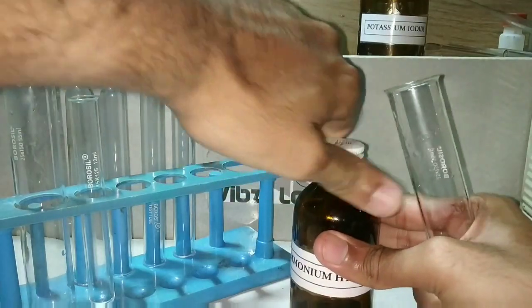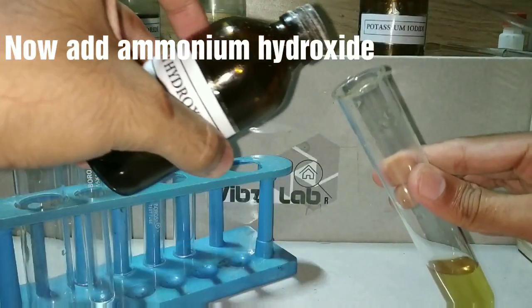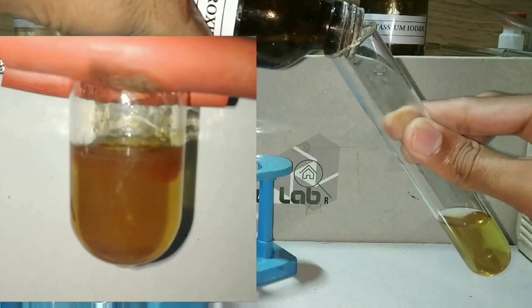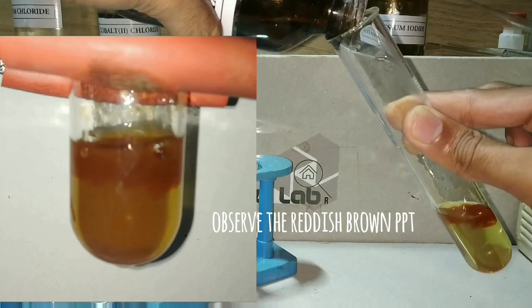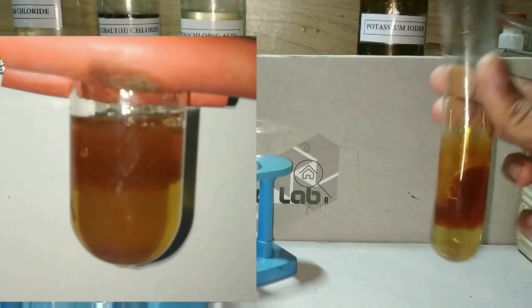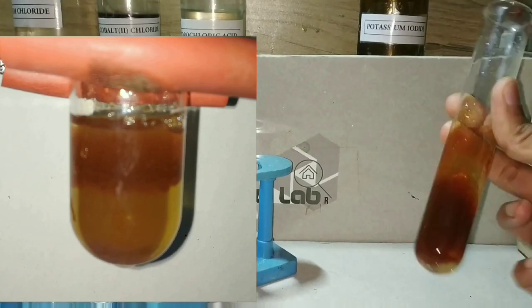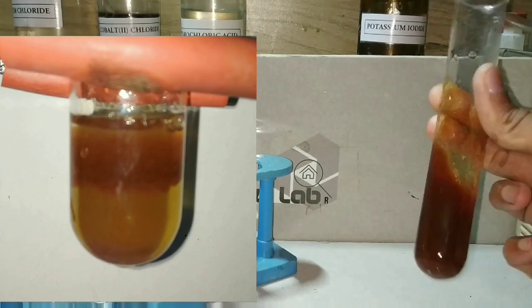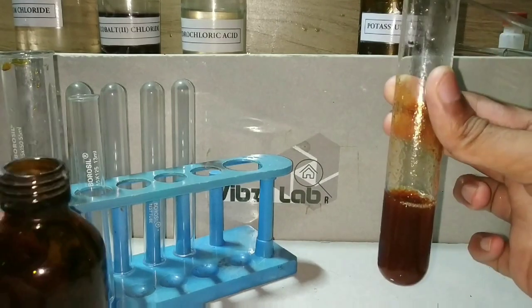Now we are going to add the ammonium hydroxide. Observe that on adding the ammonium hydroxide there is formation of a reddish brown precipitate. Add the ammonium hydroxide until the solution smells of ammonia, which means all the acid has reacted away.